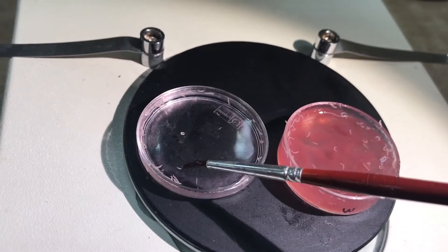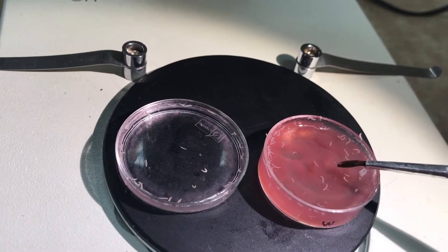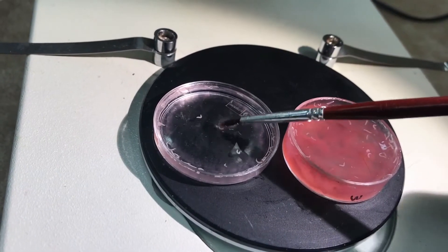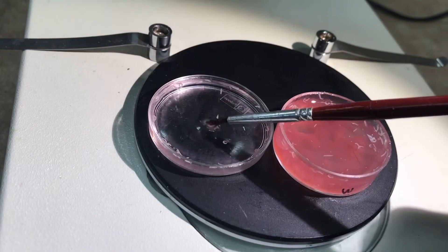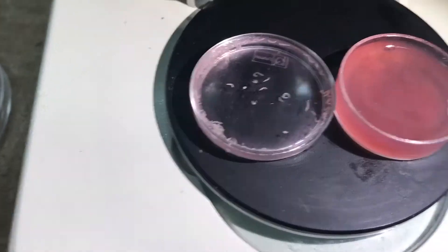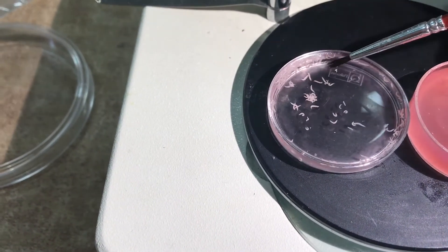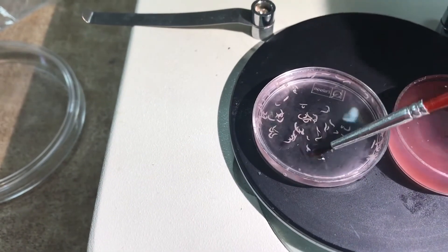Here I'm using the lid of the small petri dish. I add a little bit of sucrose in here, so I'm adding my little larvae from here — I just take them and transfer them to the sucrose solution. I cleaned my paintbrush. I collected like probably hundreds of them. Those are the guys that you will need to transfer to the food vial.